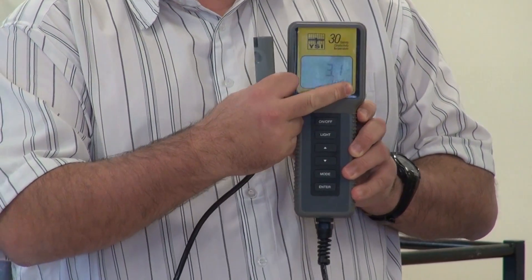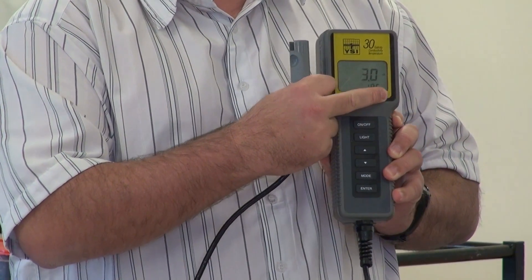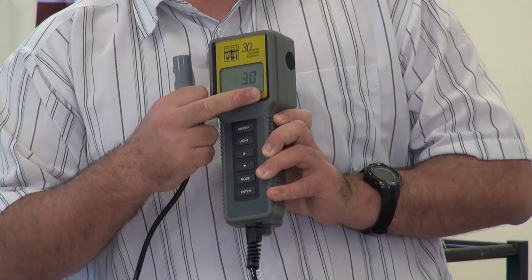Here, when you've got the temperature at the bottom and there's a flashing C, this means specific conductivity.